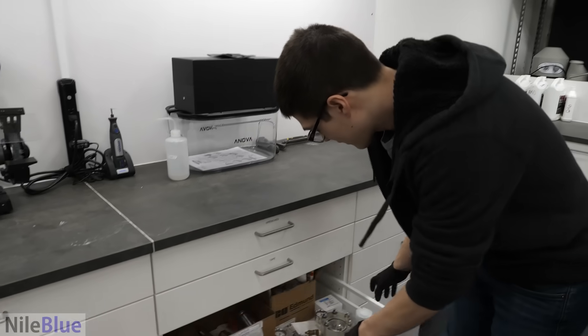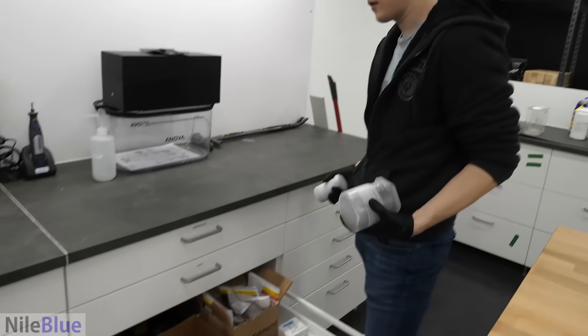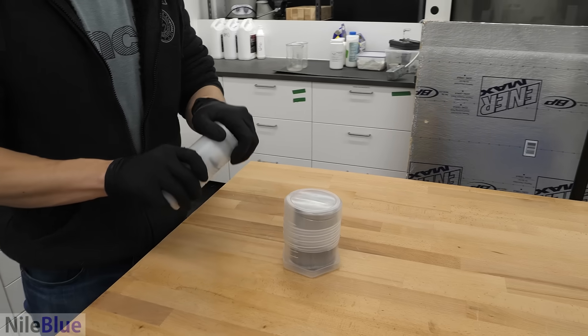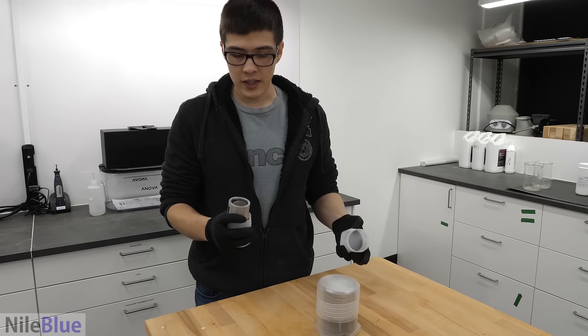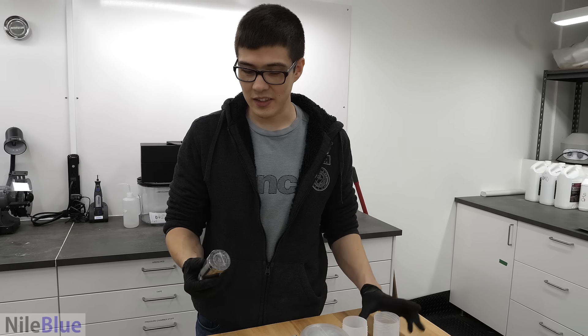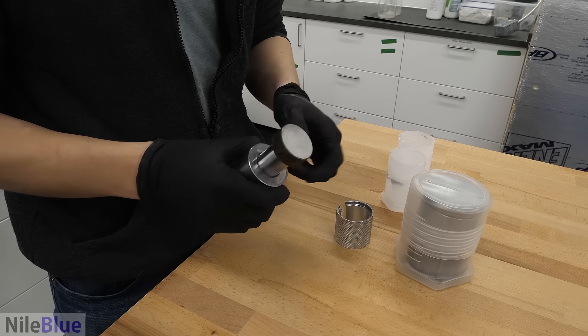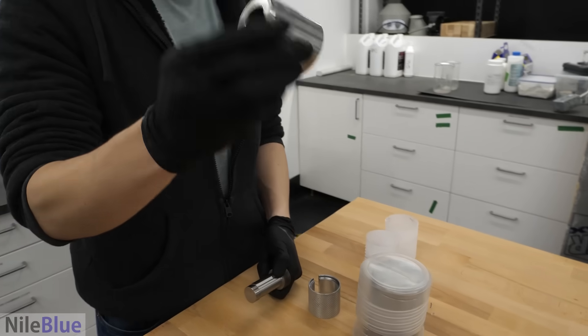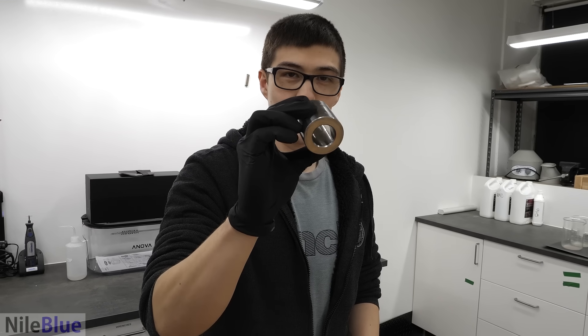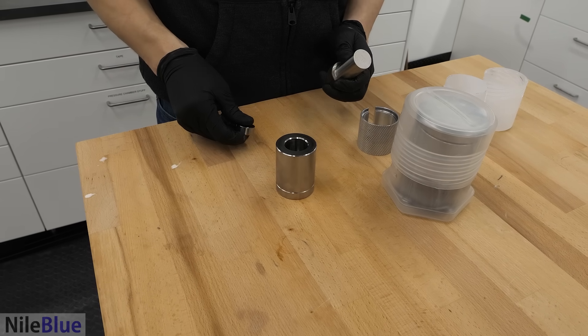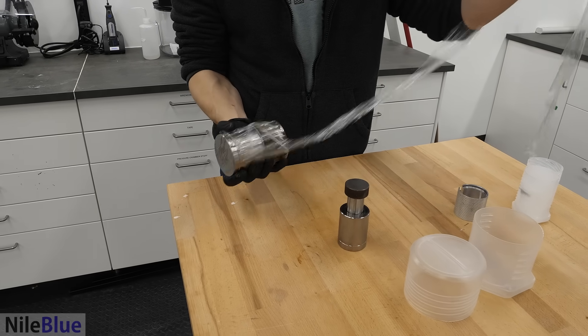Okay, so here I have two sizes of these presses. These I got for making superconductors, but I guess we could hijack that whole project and use it to make weird growing snake things instead. I don't know how they work. This is the first time I've even seen them. You just have this little tube thing. Then we just have to pack the gluconate in there. I wonder if these are just extra pieces. Giant pellet maker.